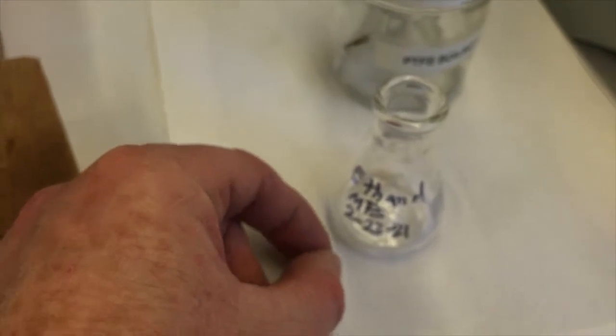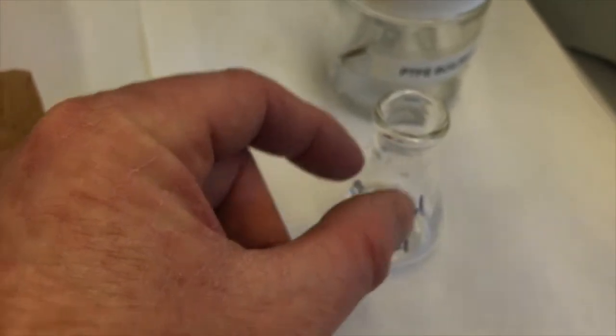The purpose of those is to cause little bubbles to occur while I'm boiling this. So I want to boil this gently. And while I boil it, it could cause large bubbles, gas bubbles within the solvent to form, and when a large bubble forms, it can bump out. We call it bumping when it kind of splashes out. You don't want that to happen.